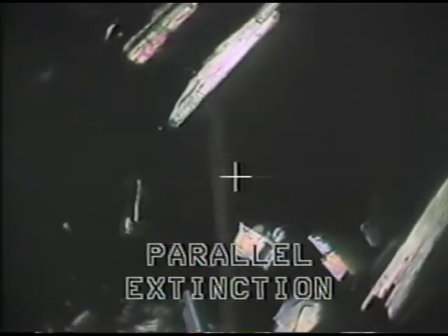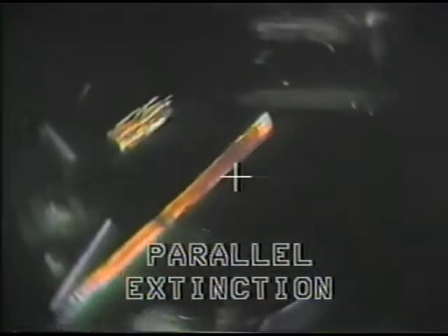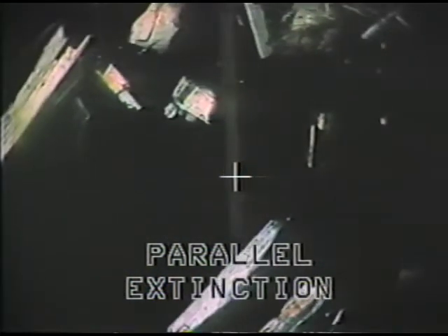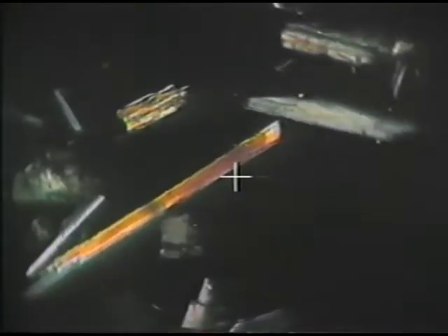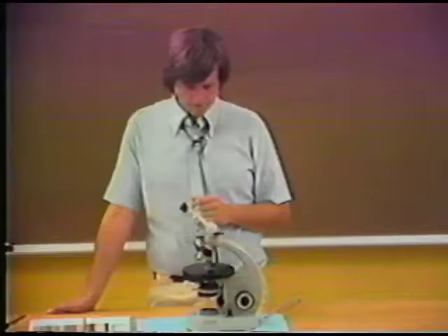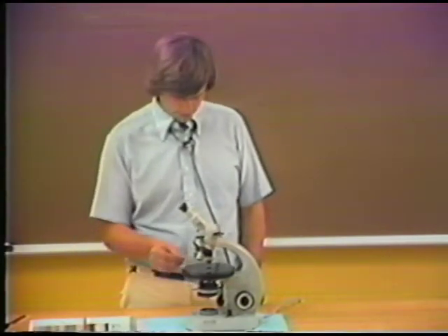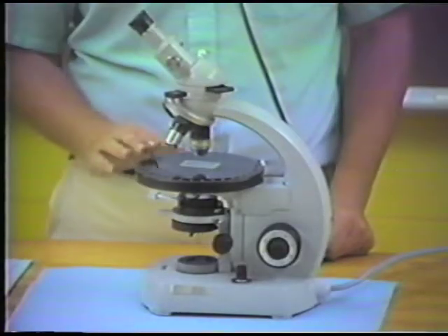This kind of extinction is called parallel extinction. A great many uniaxial minerals are elongate and show parallel extinction. And so parallel extinction is an important property of an individual mineral. You should be able to recognize that the mineral grain goes to extinction when it is parallel to the crosshairs. Well, I'm going to go back to this rhombohedral calcite to demonstrate another form of extinction.